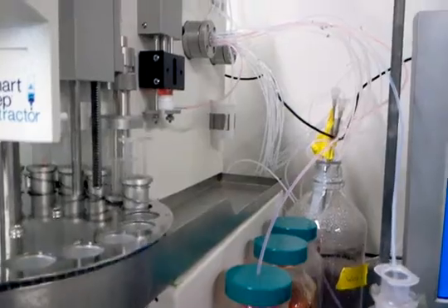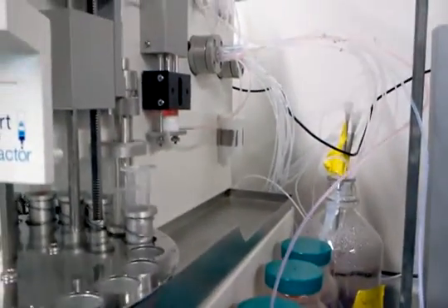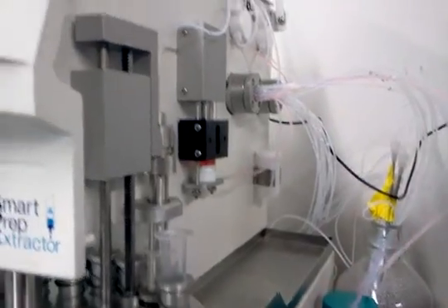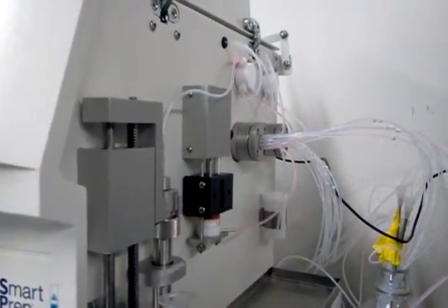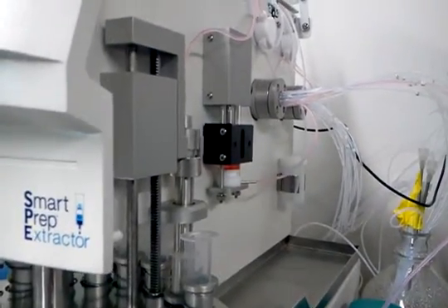Right now, what the unit is doing is pulling this orange colored water which represents methanol. You can see the colored water going through the line going onto the head of the column.